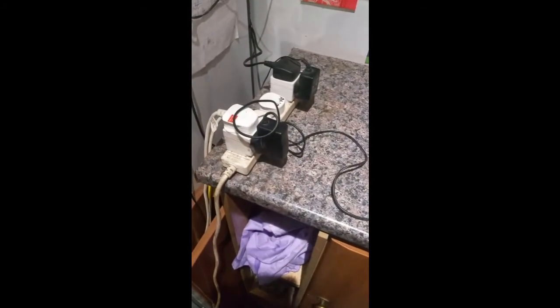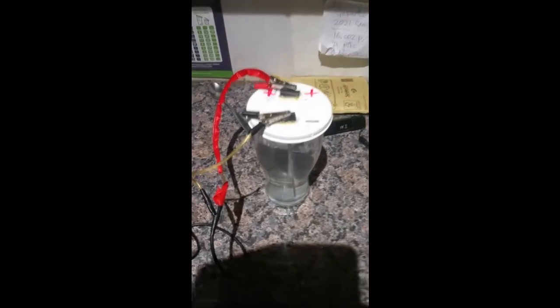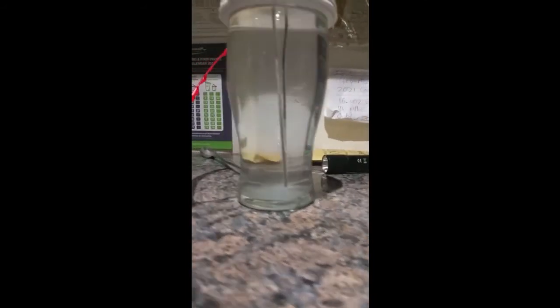Anyway, the 12 volt 500 milliamp charger is in progress behind me. This is the 12 volt 500 milliamp charger providing power to the terminals here in my pint of distilled water. As you can see, even without my light on, I've got quite a nice visible discharge of silver ions from this positive rod. If I pop that on, you get a slightly better view.